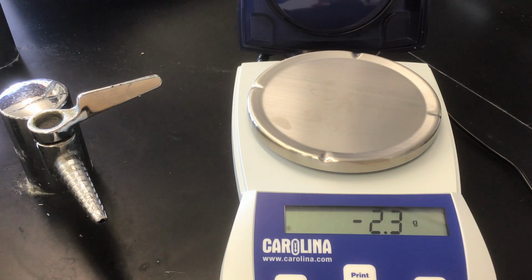All right, so today we're going to set up and run, and be able to get data from our yeast aerobic anaerobic respiration lab. And recall that yeast are microbes. They're actually in the fungi family. They're unique because they're a unicellular fungi, which is kind of unusual. But they do undergo anaerobic respiration, and they do produce, in that case, the product of carbon dioxide.